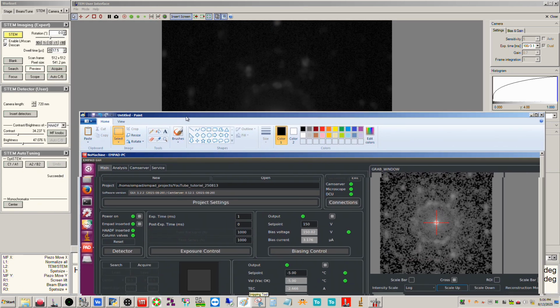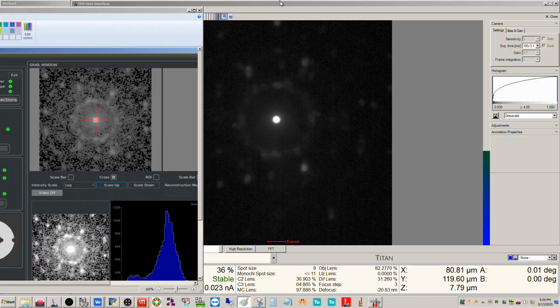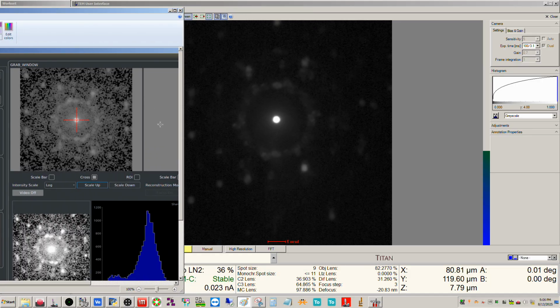If you look at the DP here, now I know this is kind of grainy, but the DP is actually flipped upside down in the EMPAD compared to what you see on the FluCam. I know that's kind of weird and counterintuitive, but I swear to you that's exactly what's happening. This is easier to see with a single crystal, but obviously I don't have a single crystal here. But you can see very clearly.